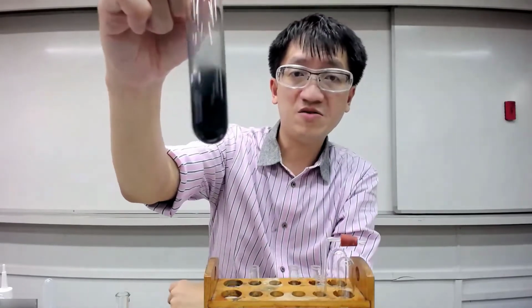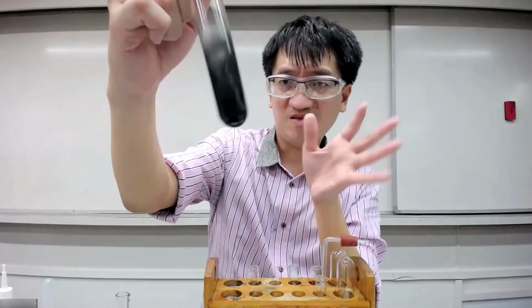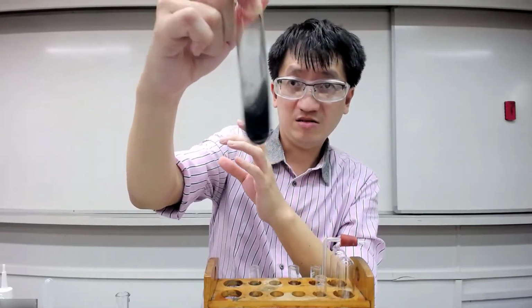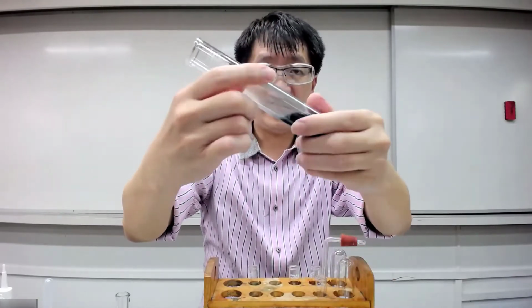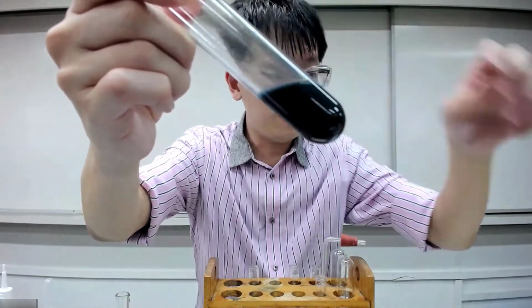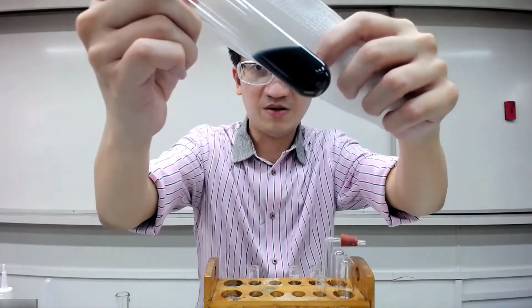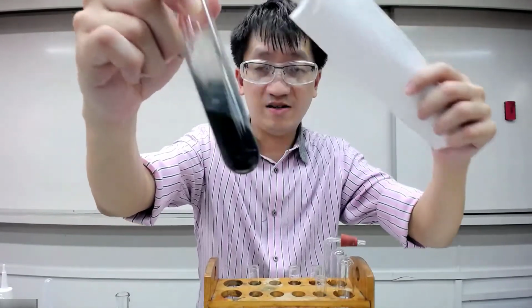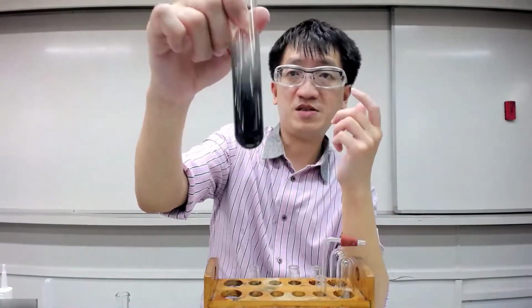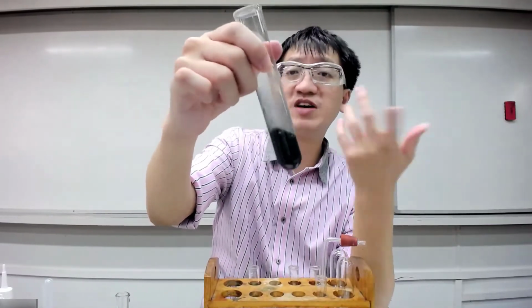The solution now becomes like a mess, like a dark blue mixture kind of mess. Okay. So I can turn the side as well. Then you can see the walls of the container, right? It's a bit reddish brown. Can you tell? It's a bit reddish brown. Some of the reddish brown PPT gets stuck. So probably reddish brown PPT, dark blue solution. With some green, you can't really tell.